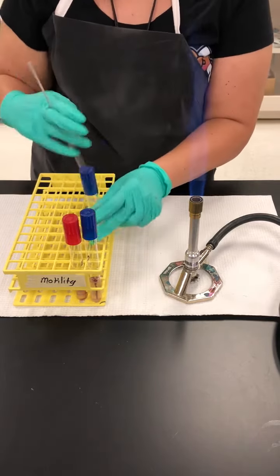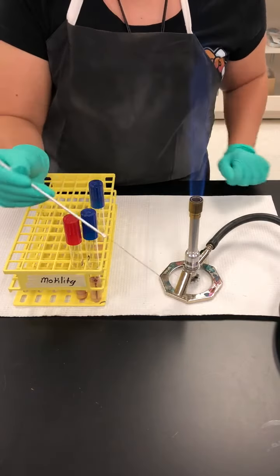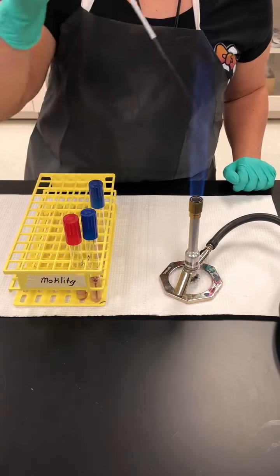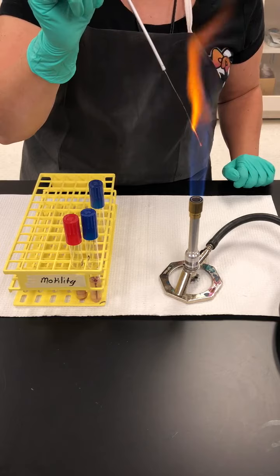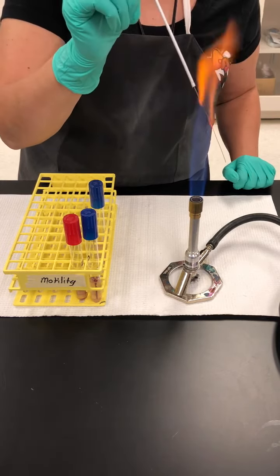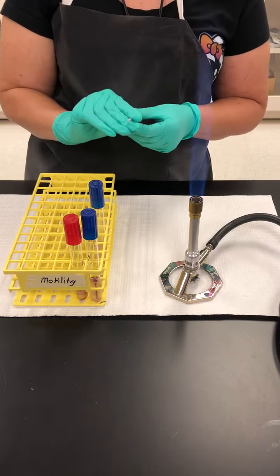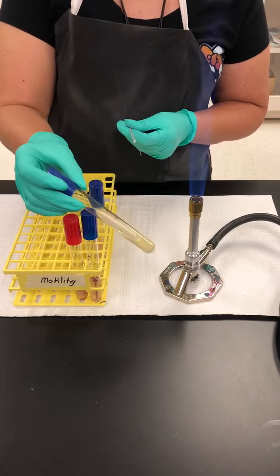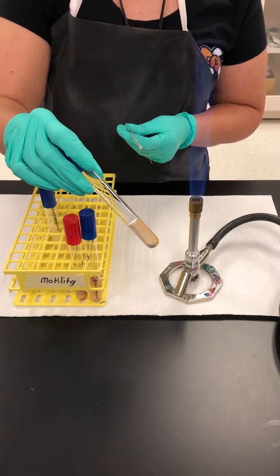For this inoculation, we're actually going to use a different inoculation tool. Instead of a loop, we're going to use a needle. And just like with any type of inoculation, we're going to do an aseptic transfer. So the needle, just like a loop, will have to be incinerated until it is orange. And we will not set it down, we're going to let it cool off, and we're going to transfer from a stock onto the fresh tube of motility.